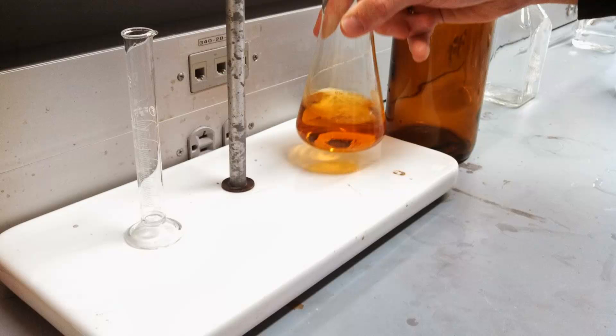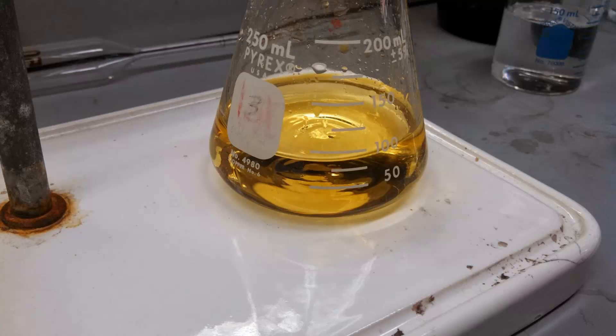About halfway through the titration, it'll look like this. It's turned from this dark brown to maybe an amber color. If you add the starch now, you will have a problem. This is way too early to add the starch. As you keep going, the amber will fade to a lighter yellow color, and this is sort of the darkest yellow where you would want to add the starch.